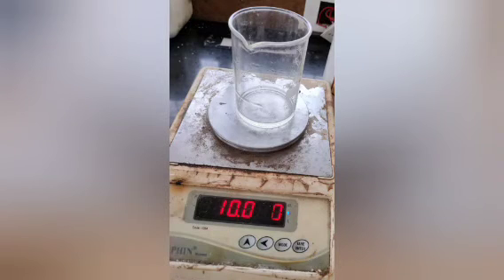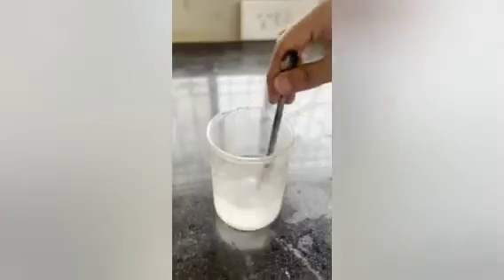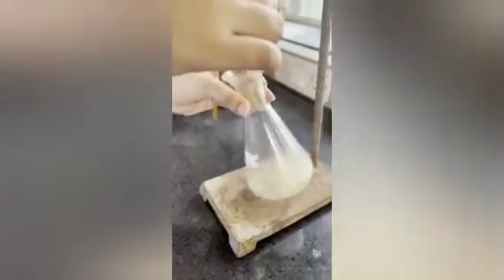Now, preparation of potassium hydroxide solution: add 10 grams of potassium hydroxide, dilute with 100 ml of water, and pour into a burette. You can take a burette of 50 ml or 100 ml for titration. Now titrate the solution with the potassium hydroxide solution until the solution converts into a light yellow color with lower layer formation.